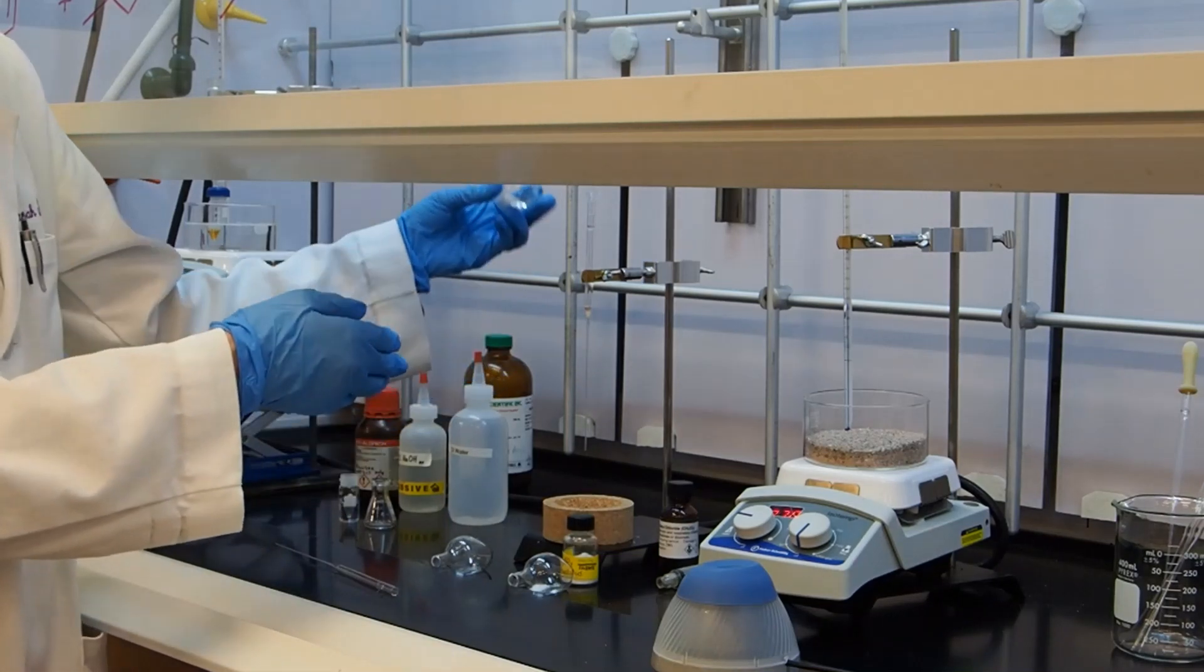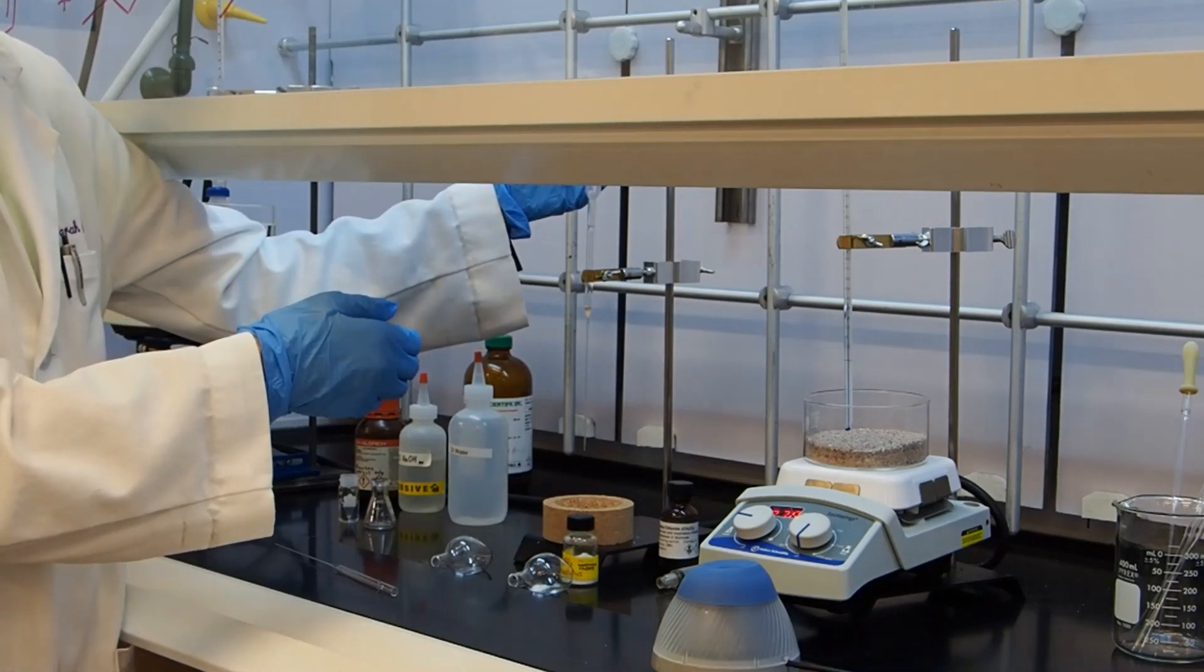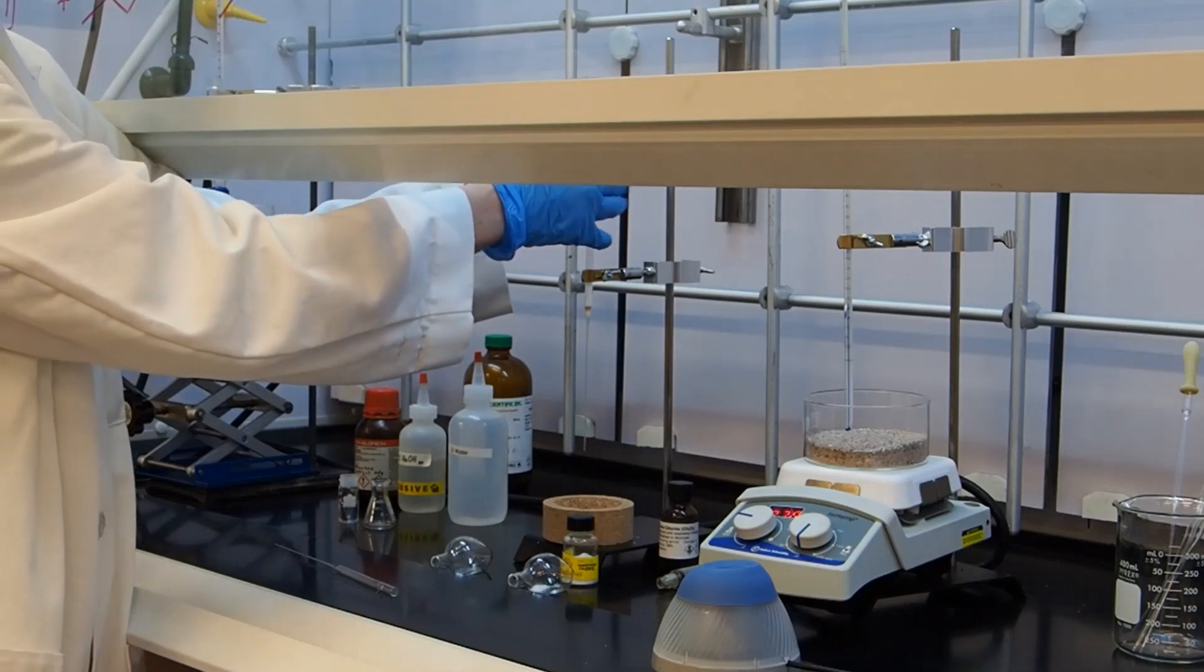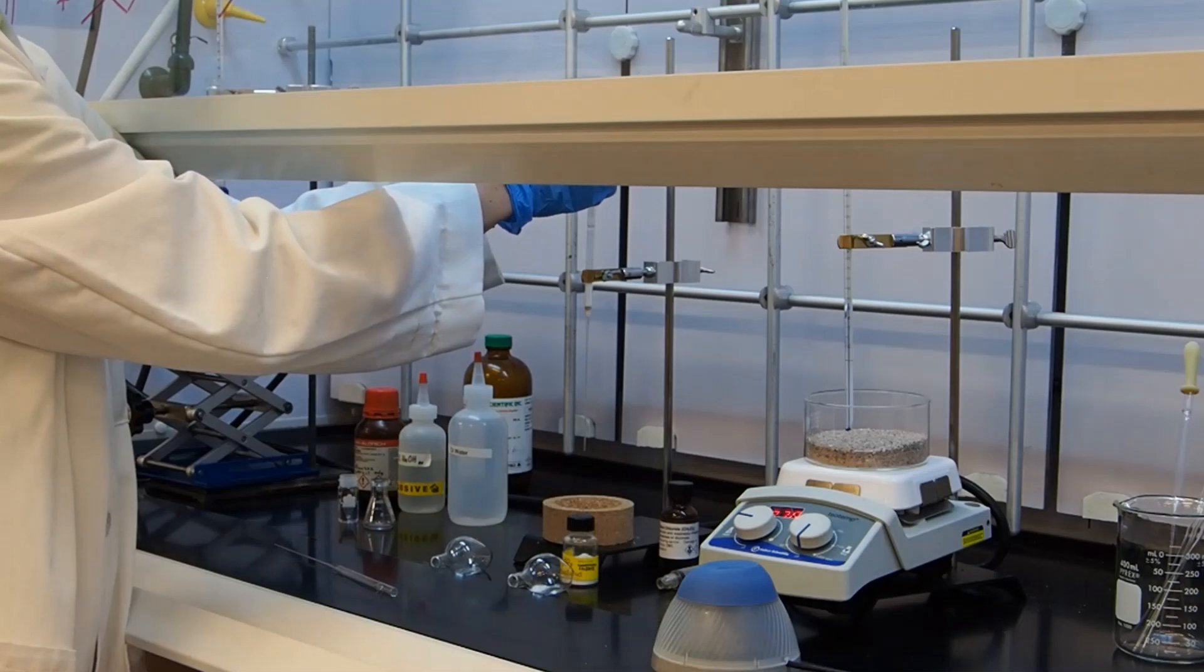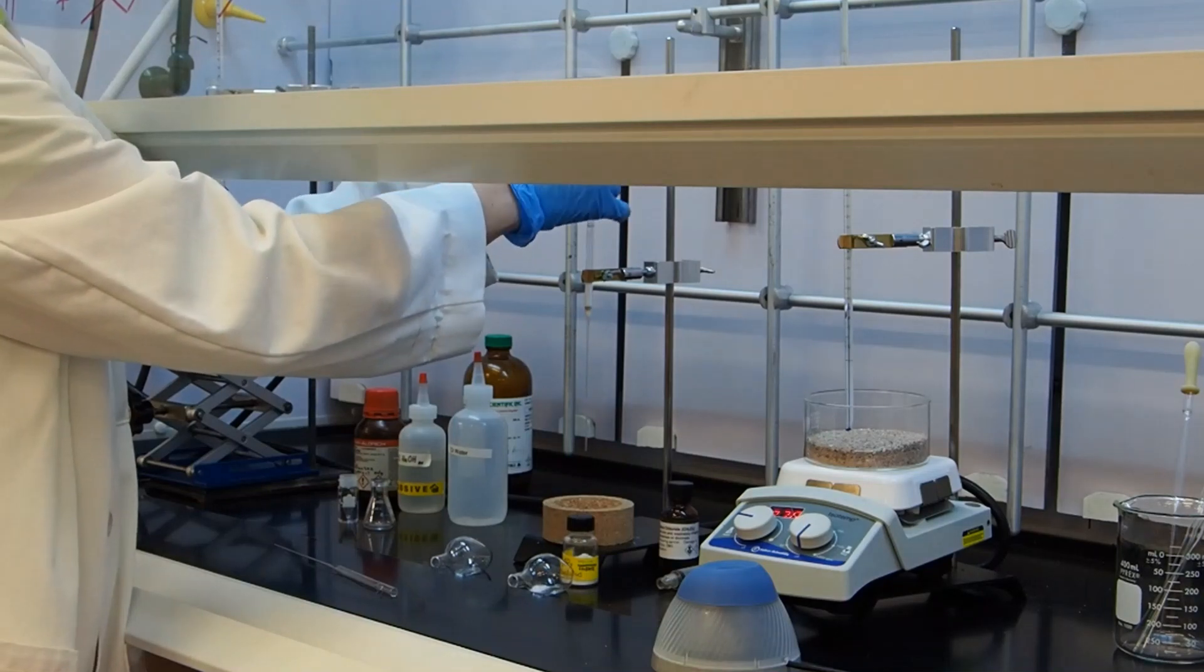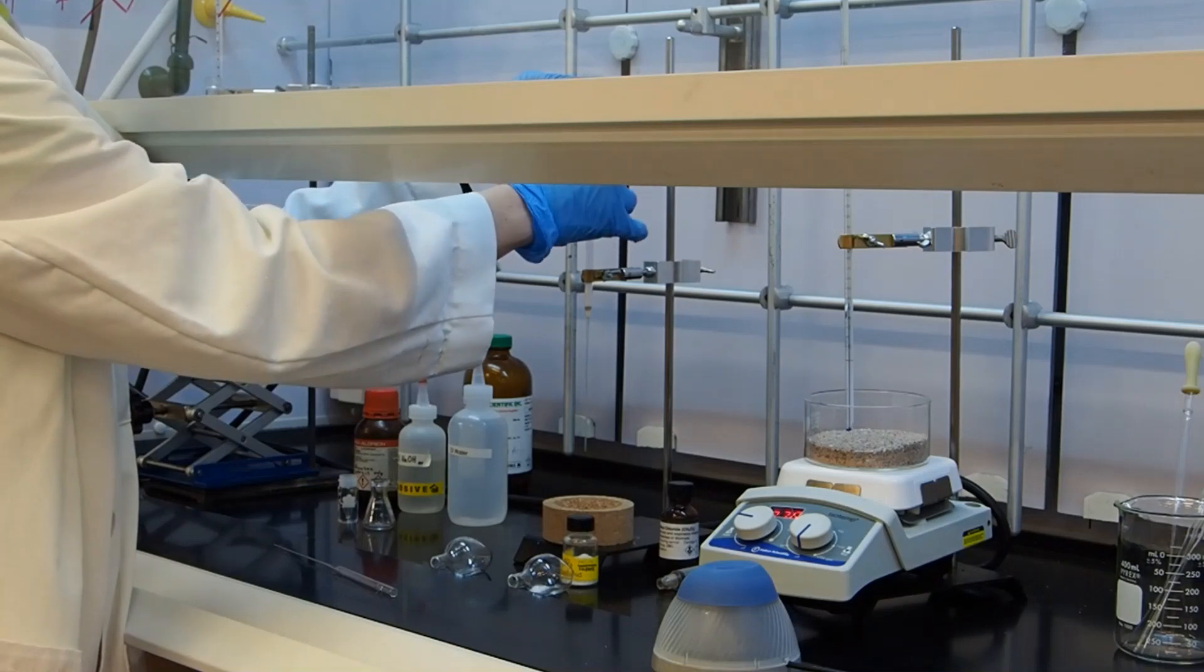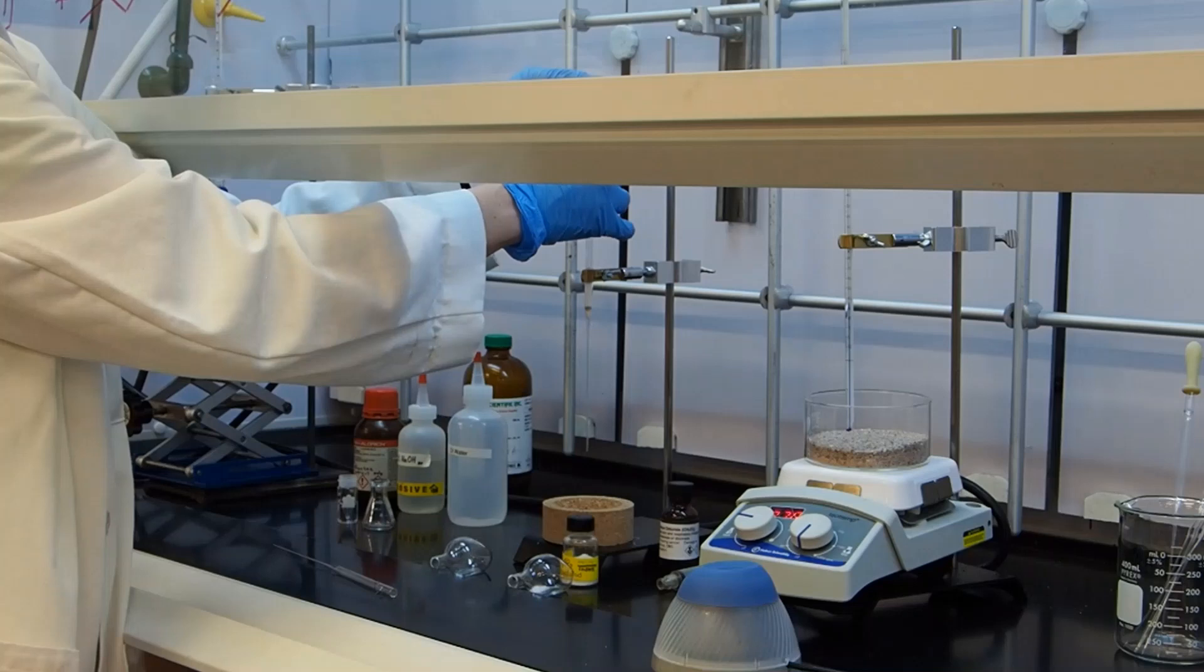You want to be careful with silica gel and handle it in the hood when you can because breathing it is harmful. It causes a condition called silicosis. You can see that the length of my column is only about an inch long or so.